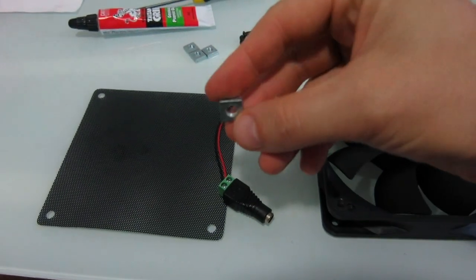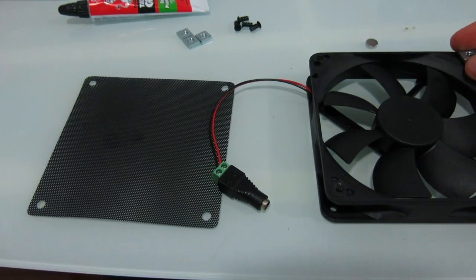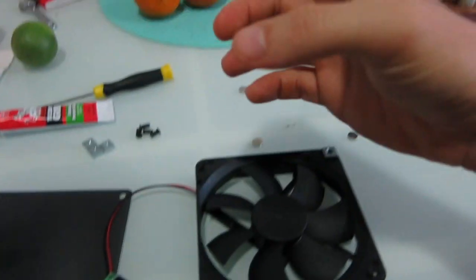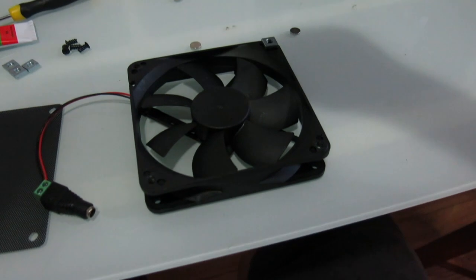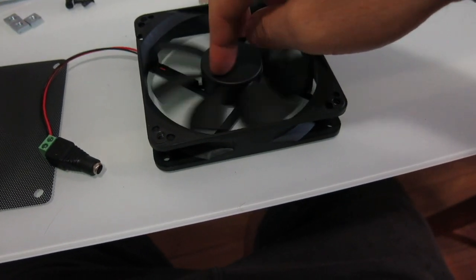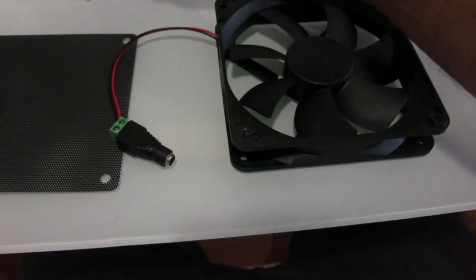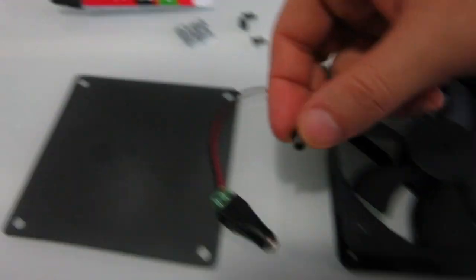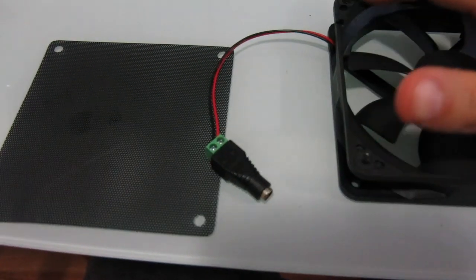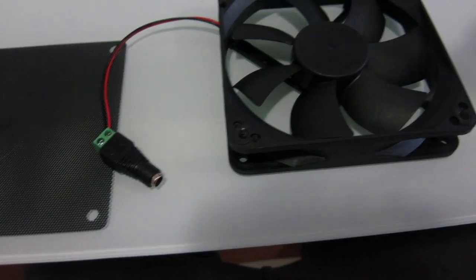These are just some spare square nuts, and that's purely to act as a spacer, so when the Erlenmeyer flask sits on top, this keeps it from sitting on the fan motor, stressing it out with weight. These are just the screws to screw the top plate on the fan.